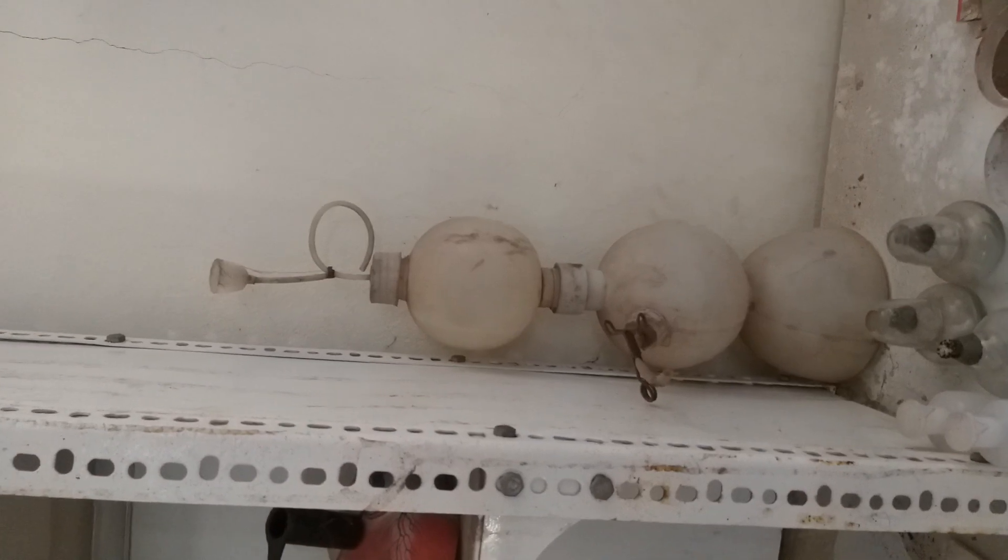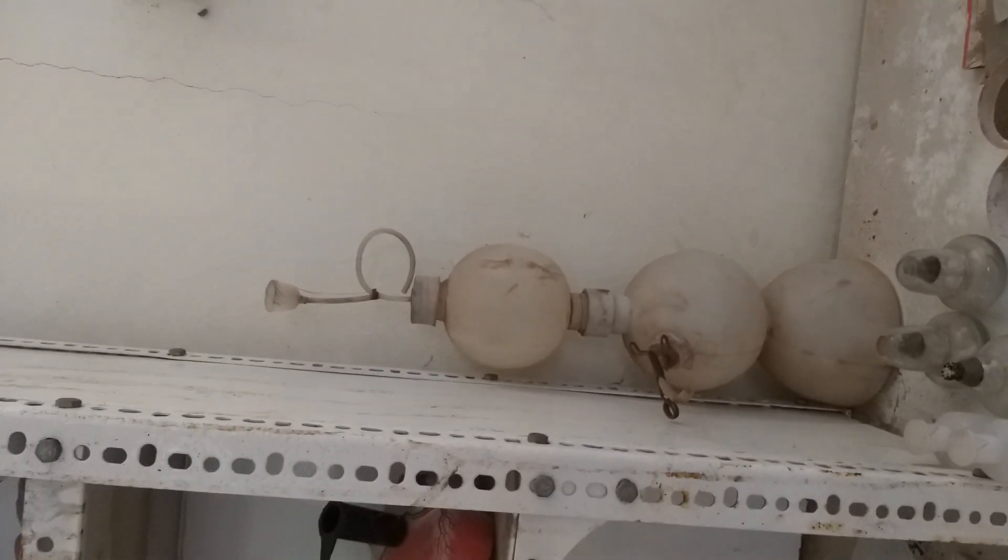This is Kipp's apparatus used for the production of hydrogen sulfide gas from iron sulfide and hydrochloric acid. Spirit lamps are also there.